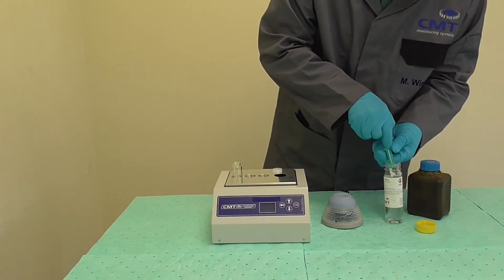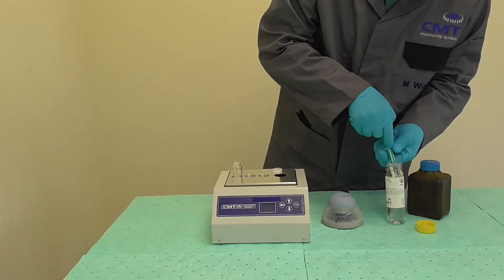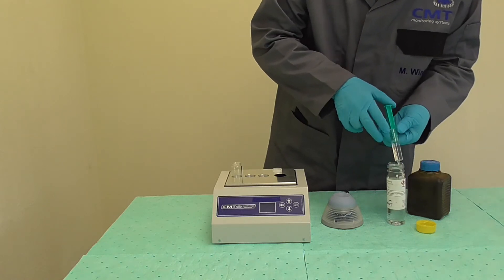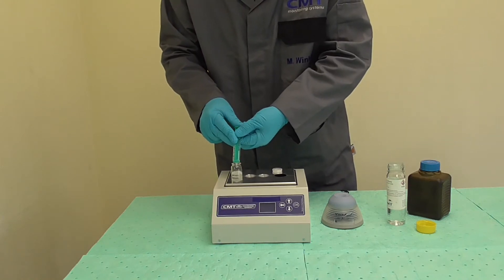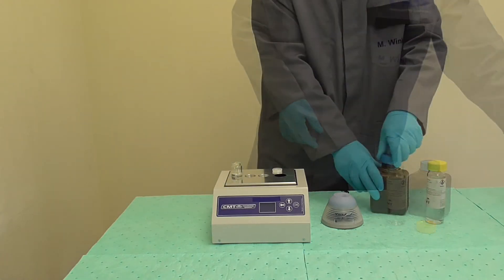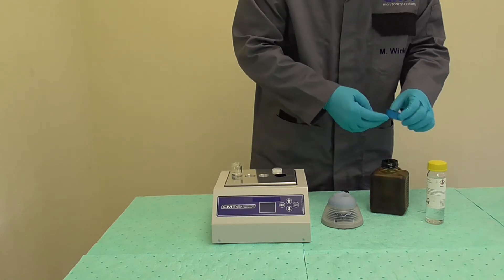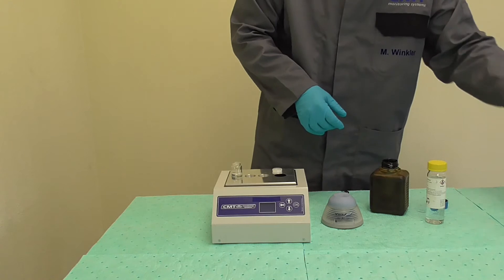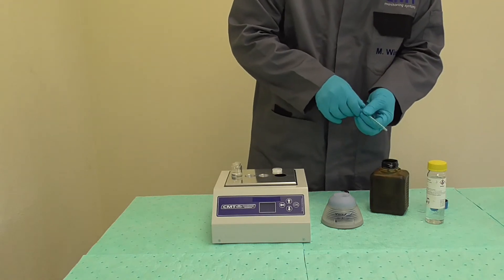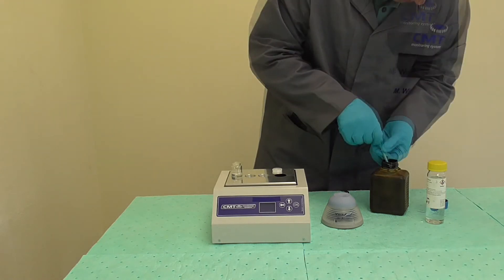Take your fresh fuel sample, which you have taken at operating temperature using a fuel oil sample bottle. Take one milliliter of fuel from the sample using the one milliliter syringe provided.